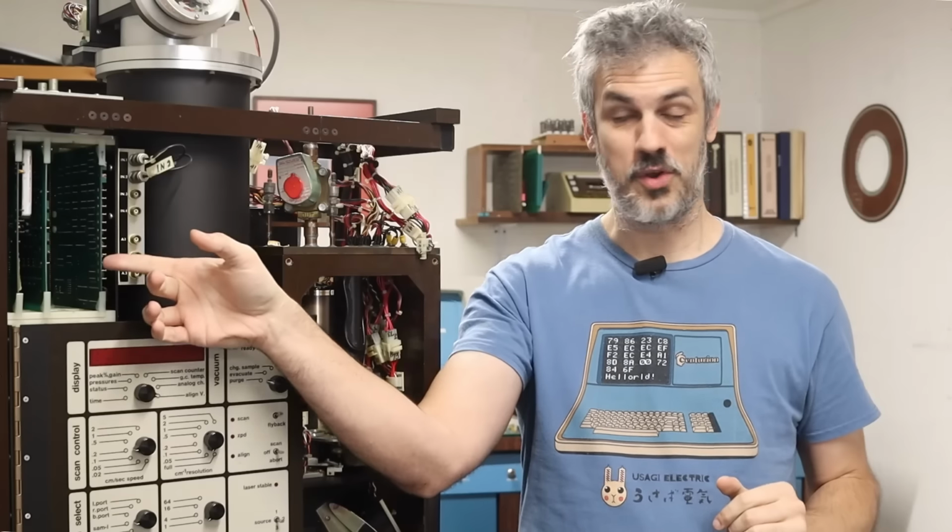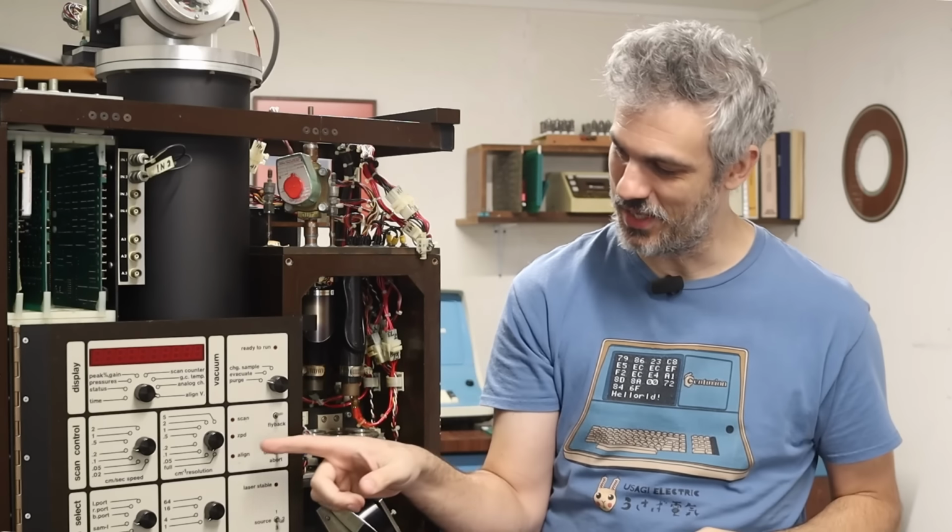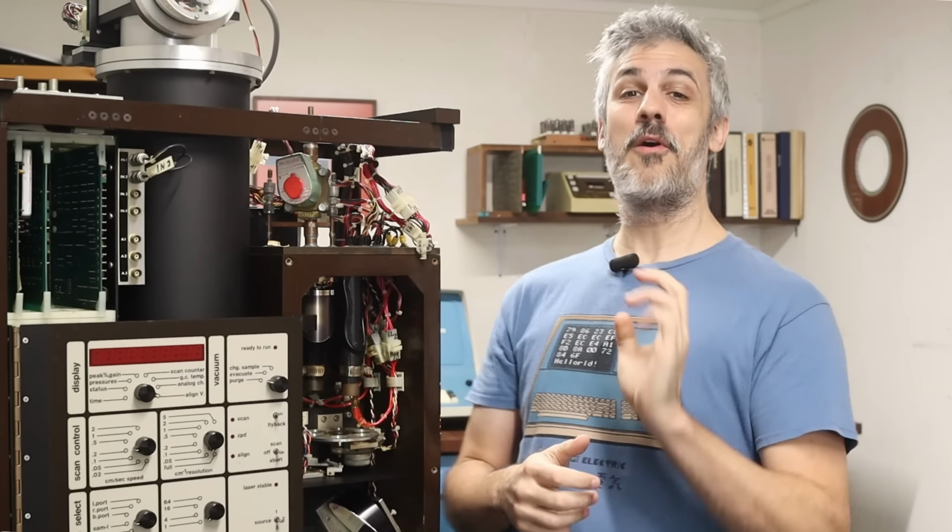Now that we have the correct card in the card cage, I'm hoping to see the laser come on, the mirror start to move, the alignment voltages to do aligning stuff, and us to get a little light right here that says align, which would say that the whole machine is kind of up and running and ready to go and ready to start doing measurements. But you know, I'm not expecting this to go all that smoothly.